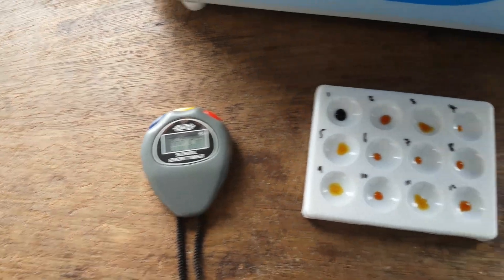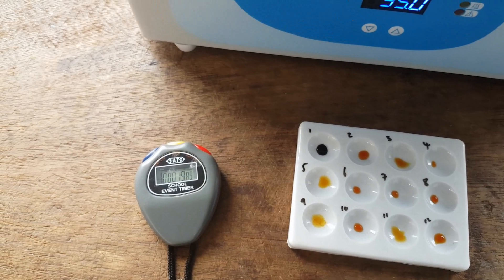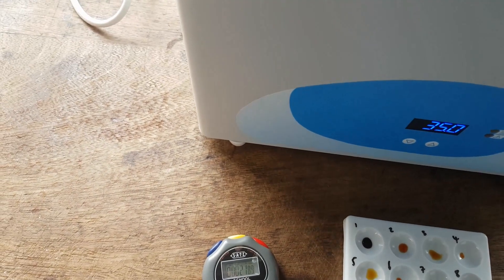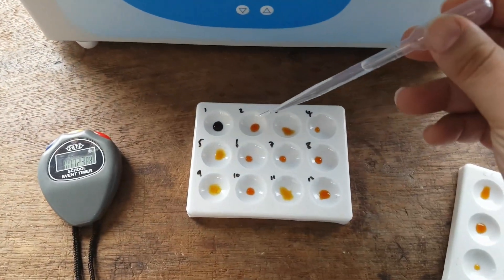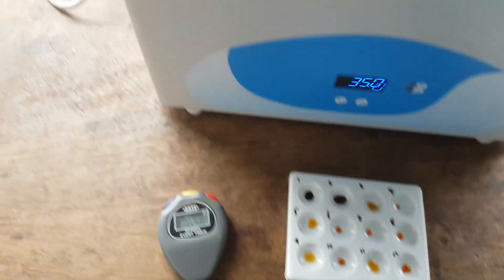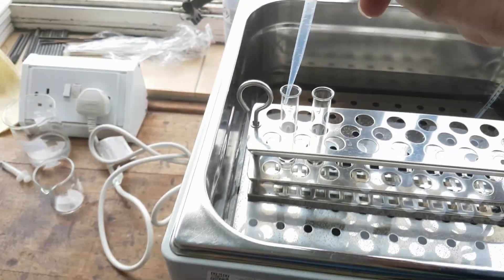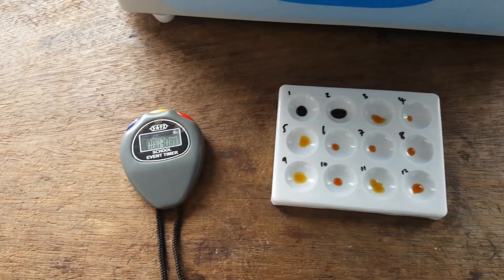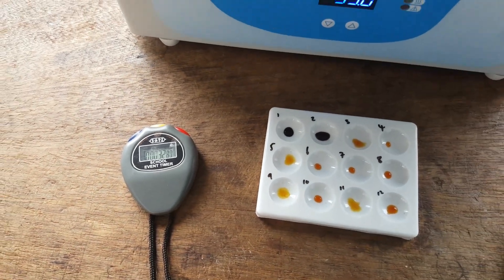Now, every 20 seconds, I've put the remainder in. So I don't want anything left in my pipette. Every 20 seconds, I'm going to draw some more out and place it in there. Okay, so that's 20 seconds. I'm going to draw some more out and just put a dot on there. Right, place that back in, place the remainder back in. Wait another 20 seconds and watch for the color change until it stops changing.